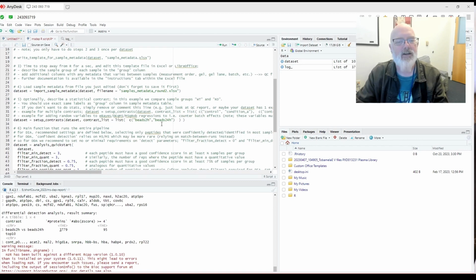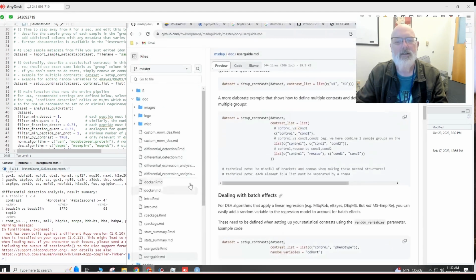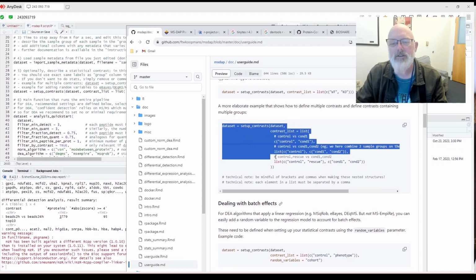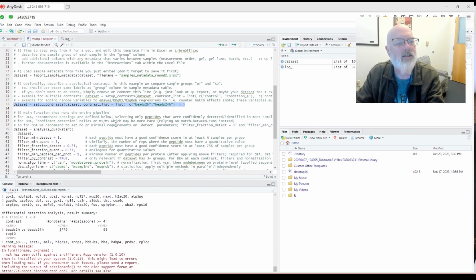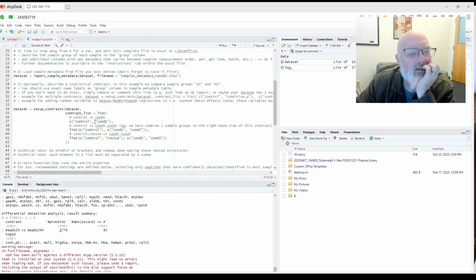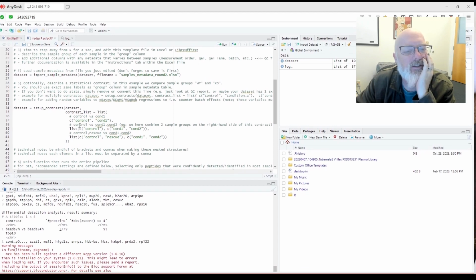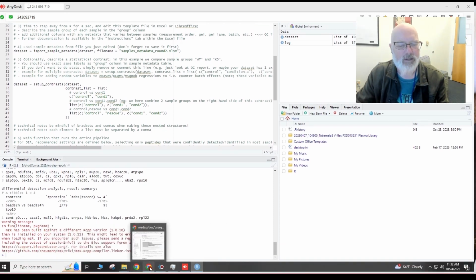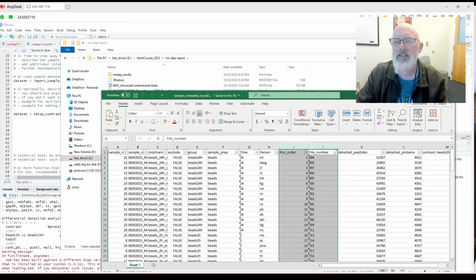Okay, so we could go data contrast. So instead of doing beads 2 hours versus 24 hours, there's a nice little contrast setup in the manual. So we can do something even more fancy here. We can delete this, and we can put this in there. And then this will be condition 1, condition 2, and then for example, let's open the round 2 file again, just to make sure, because these are all case sensitive.